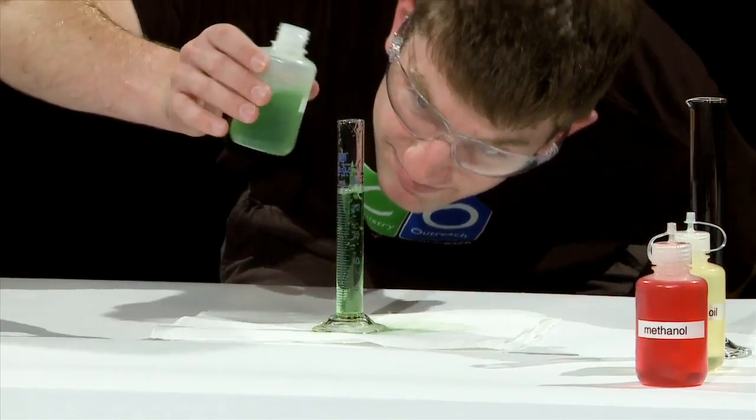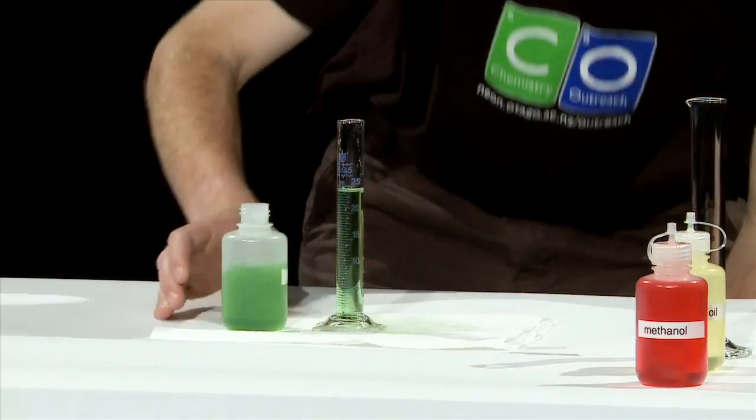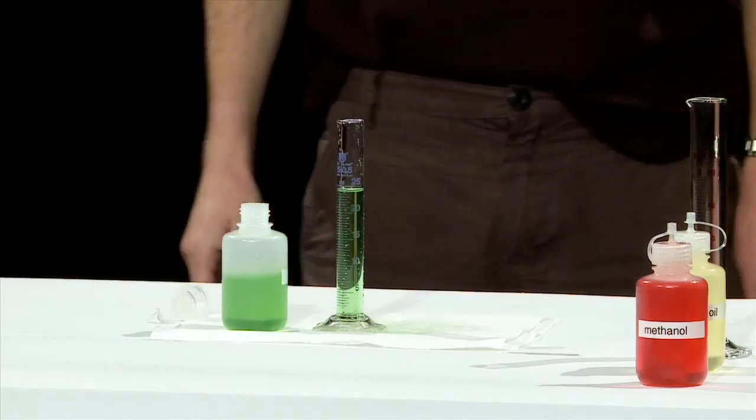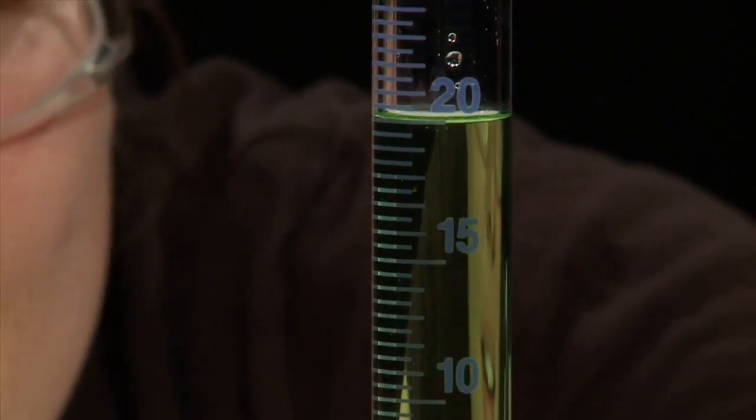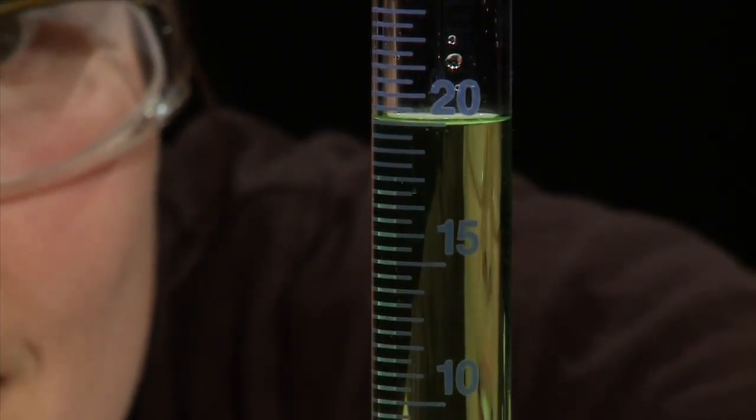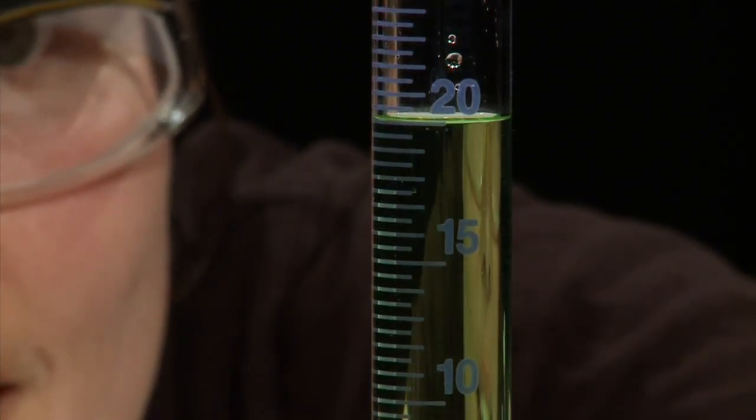Now make sure you measure carefully so you don't go over the top of 20. Oh dear Matthew, oh dear. If we have a look back at Trudy though, we have a perfect 20 milliliters.